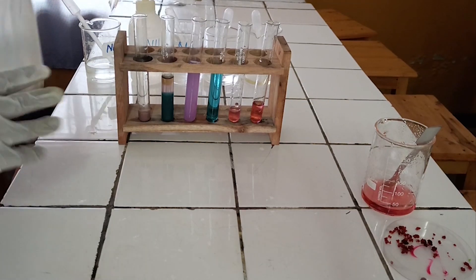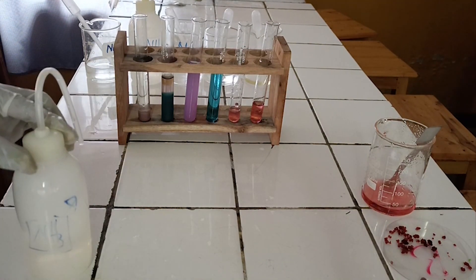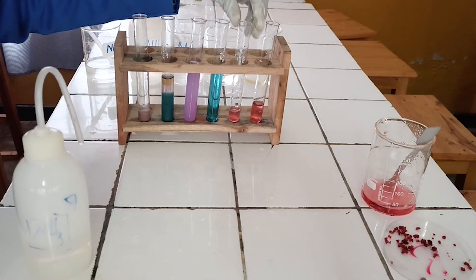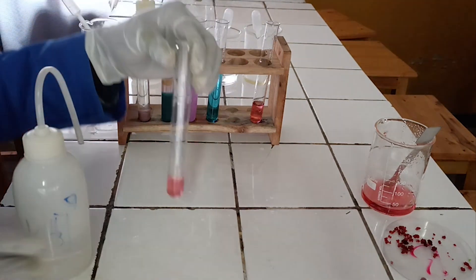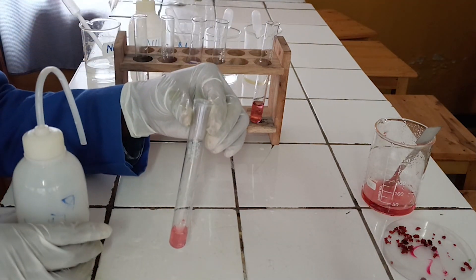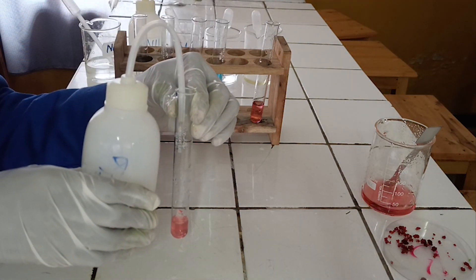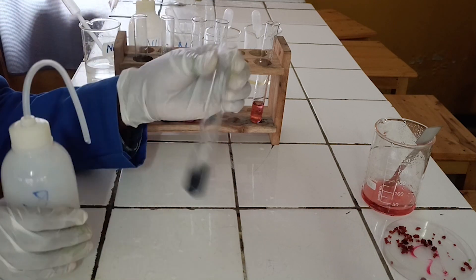Second confirmatory test: to the fifth test tube, add concentrated ammonia dropwise until in excess, followed by a few drops of hydrogen peroxide.